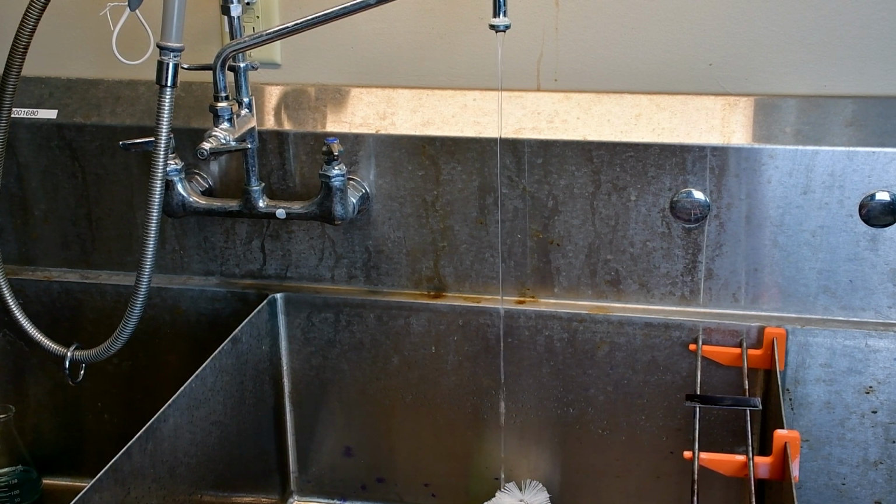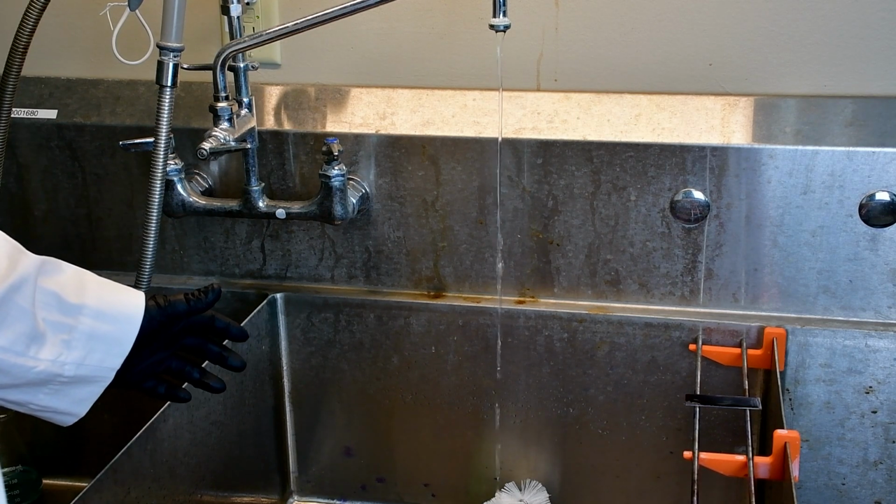Well, the general principle behind the gram stain is that we're introducing a stain, which is our gram violet, and we're introducing a counter stain, which will be our safranin red, which we have not seen yet. I add my gram violet, which gets absorbed by all my organisms, and then I add my iodine, which is going to lock that stain into a select few organisms. I'm then going to decolorize it, washing out the stain from everything that doesn't hold on to the gram stain, and then I'm going to counter stain with the safranin red. What that is going to give me is organisms that stain purple or violet are going to be gram positive, and organisms that stain red or pink will be gram negative. My timer is just about up.